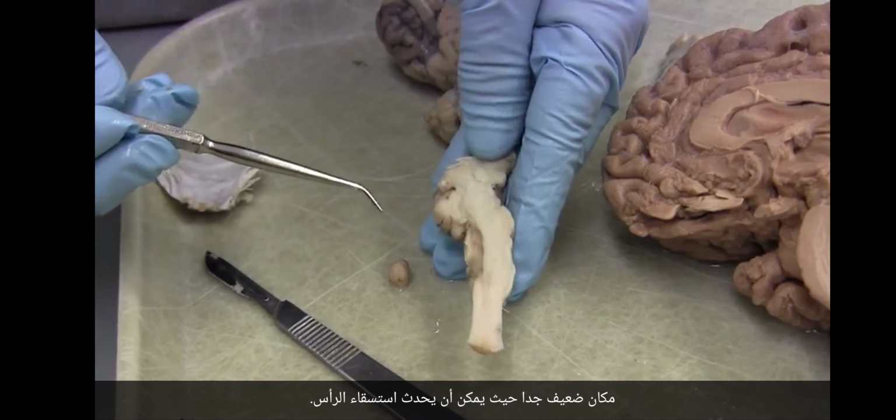Look at that. I think it's very pretty. And you see it's diving down, but do you see that it dives down and it goes back? And so let's follow it as it goes back.